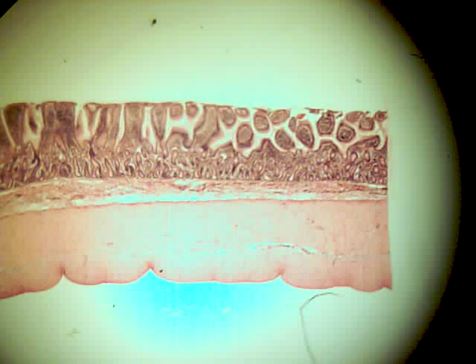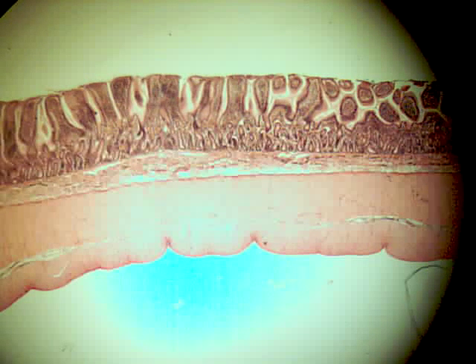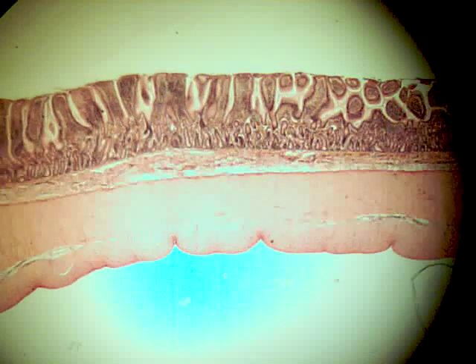This is the composite muscle slide and it's probably the most confusing because there's three sections of different types of muscles on each slide. There is a cardiac muscle, skeletal muscle, and smooth muscle. At the scanning power, going from one side of the slide to the other, it's also confusing because there's different layers. On this one, you're going to be looking at the very bottom layer to see the muscle layer. There will be another section in the middle — this is the cardiac muscle — and then another section after that. It gets a little confusing because you have to know which layer to look at and you have three different sections to choose from.